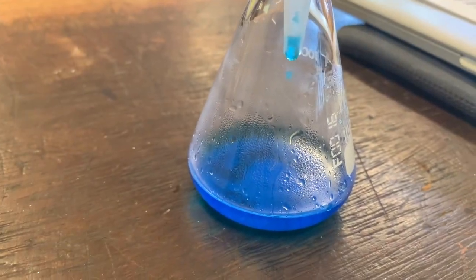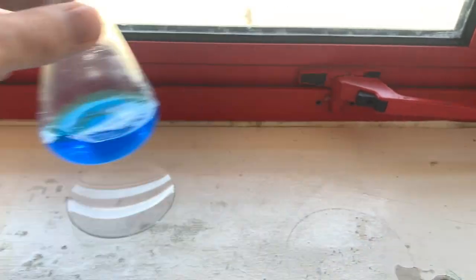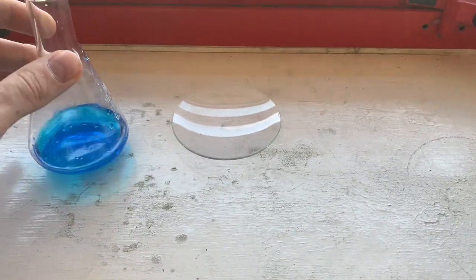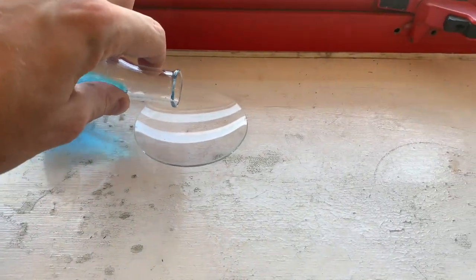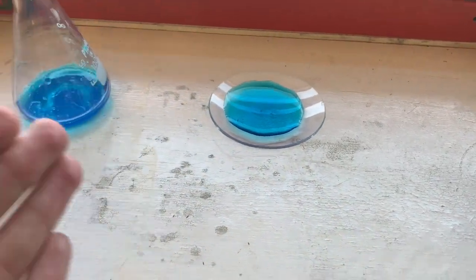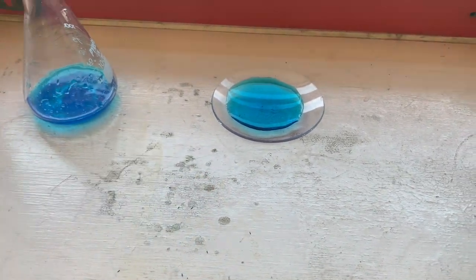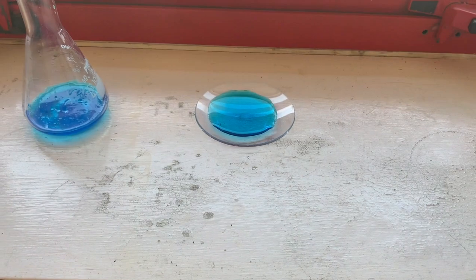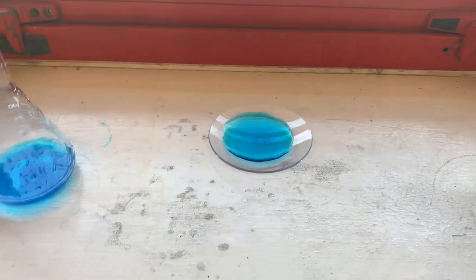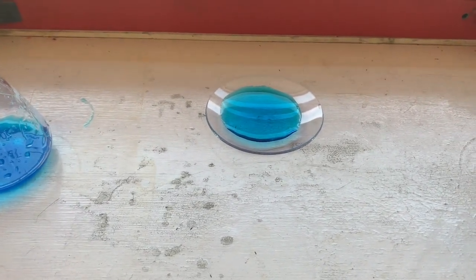And this would be really nice for us to evaporate. Lastly, we're going to use the power of the sun to evaporate my solution. So I'm going to take my hot sample of liquid here and pour it onto this watch glass. What will happen is that when this water evaporates, we'll be left behind with some really nice copper sulfate crystals. So I'm going to leave this over the weekend and hopefully when I come back, we'll see a really nice sample of copper sulfate.